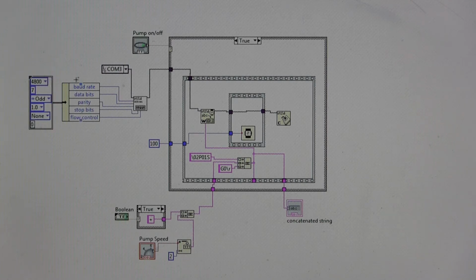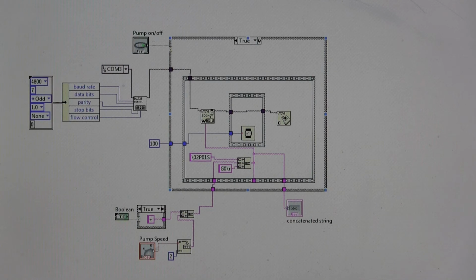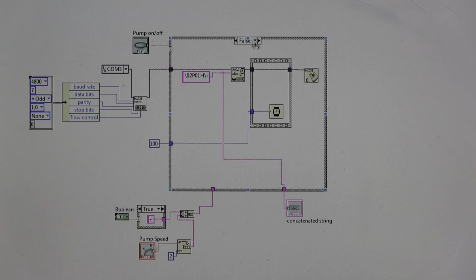Again, we have all of our settings for the RS-232 communications, and we configure the serial port, tell it we want to communicate with it. It's on COM3 again, and notice you have the pump on off right here, which is connected to this case structure. Now, if it's on, it's true, and if it's off, it's false. Let's start with false so I can describe this to you.